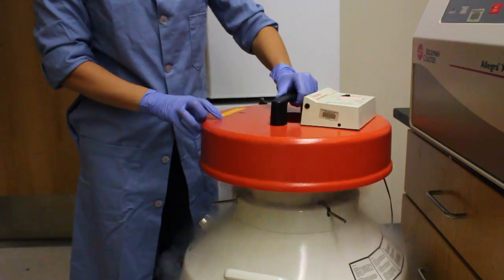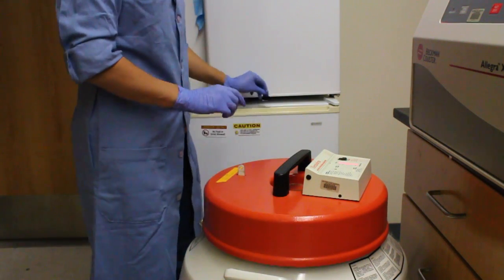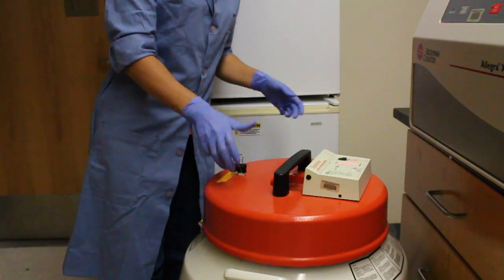Placing the lid back onto the nitrogen tank, we'll put the safety pin back on and hit reset. That's all.